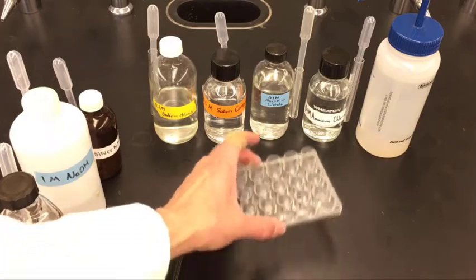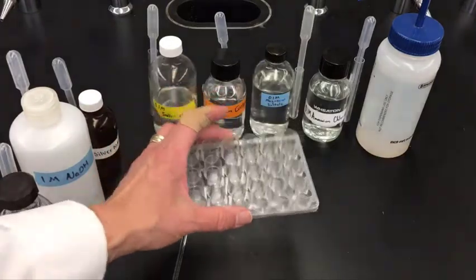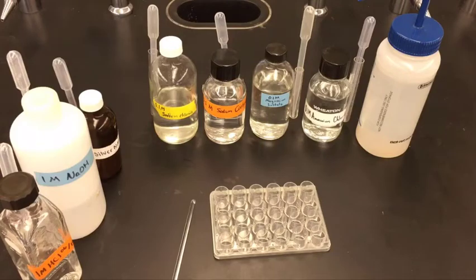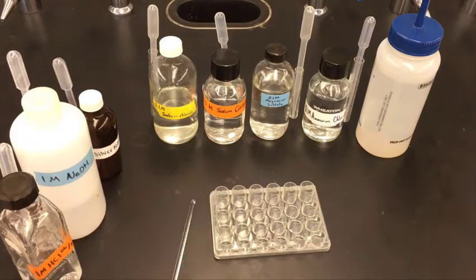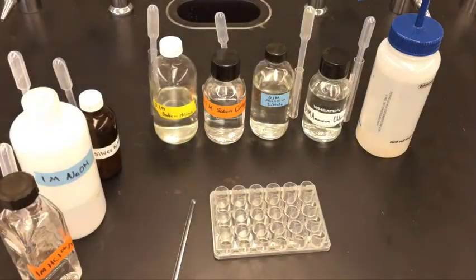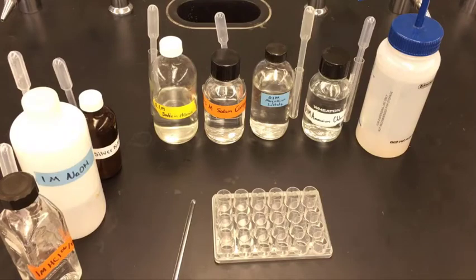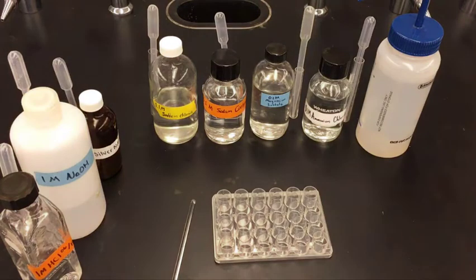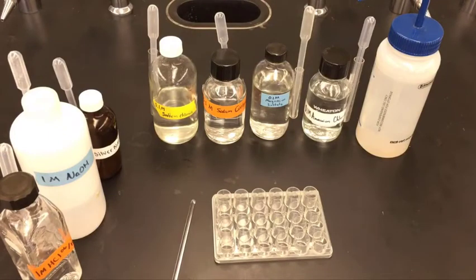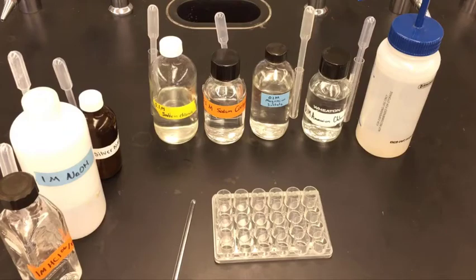These well plates have a depth that will actually hold two milliliters. This is a very qualitative lab, so we're just using our senses to see what happens when we add two clear colorless liquids together and look for a reaction. We're looking for color change, formation of bubbles, formation of an odor, formation of heat, or a precipitate — which is basically a solid that forms in solution.